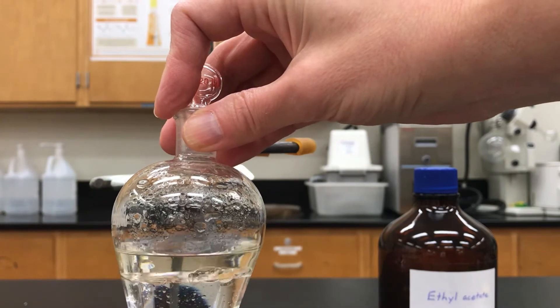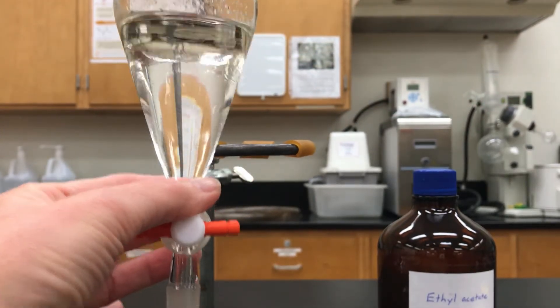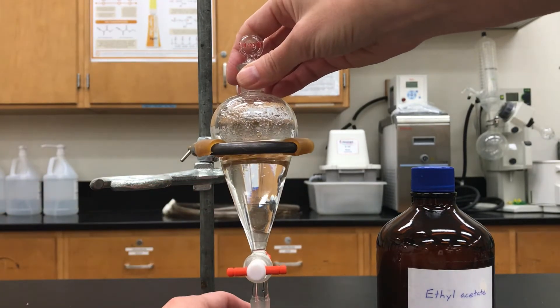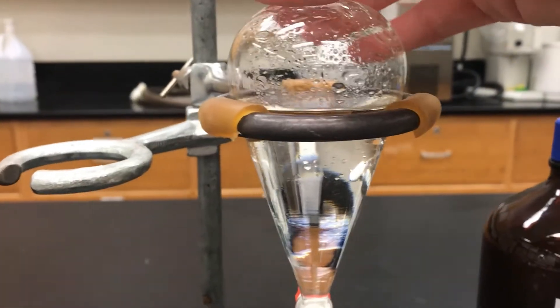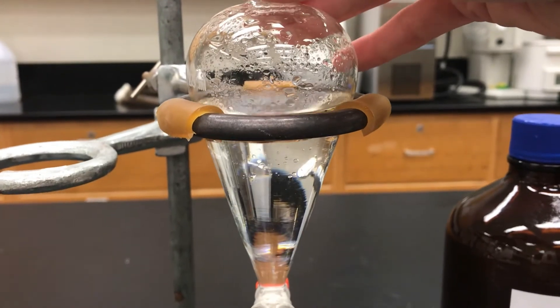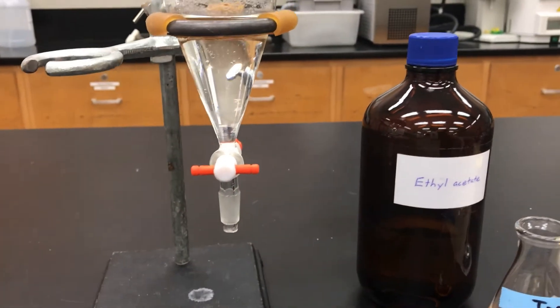Now here's something interesting. If you look at that top layer, I think it has a tinge of yellow in it. That means there were methyl red molecules still left in the bottom layer, and by adding fresh ethyl acetate I was able to extract them into the top layer. So I did get a better yield of my methyl red.